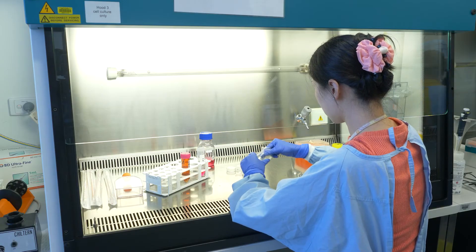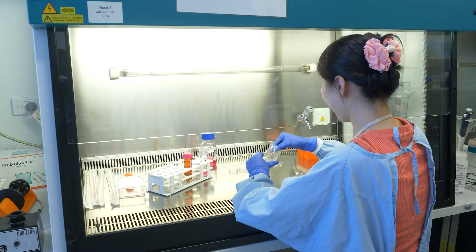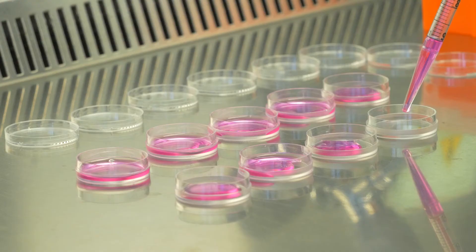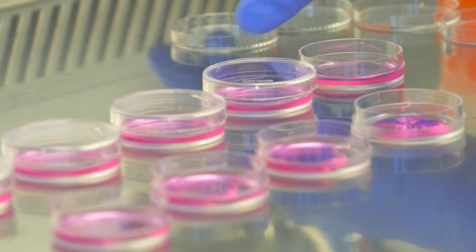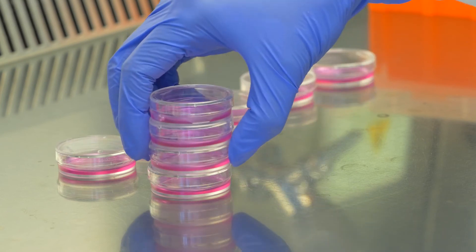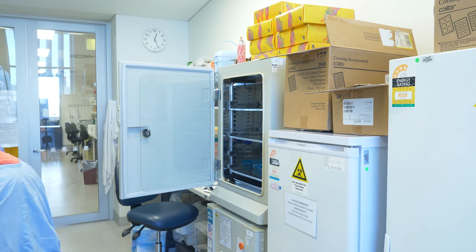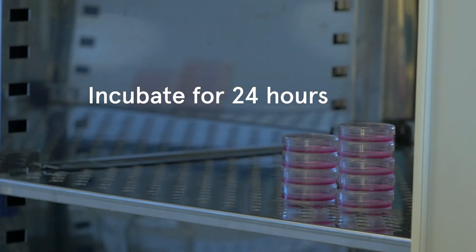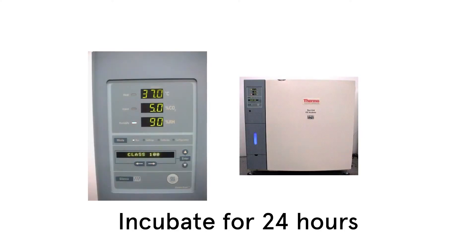First, we need different culture dishes to make our samples. JJ will transfer 1 ml of the media containing the cells to each dish, making sure the media covers the entire bottom surface of the dishes. Next, the prepared dishes will be transferred to an incubator. The CO2 incubator is an essential piece of lab equipment for cell culture work; it creates a contamination-free environment while maintaining constant temperature, humidity, oxygen, and carbon dioxide levels. We leave the samples in the incubator for 24 hours so the cells will attach to the bottom surface.